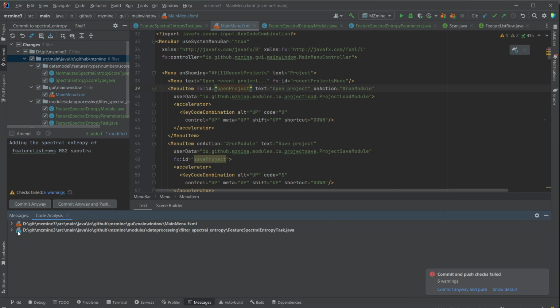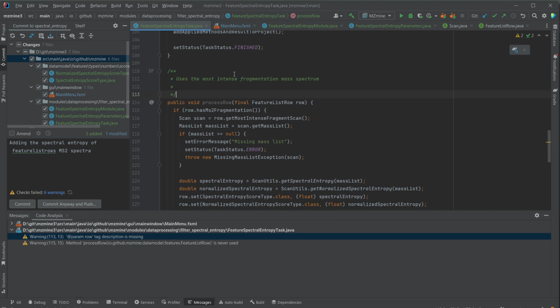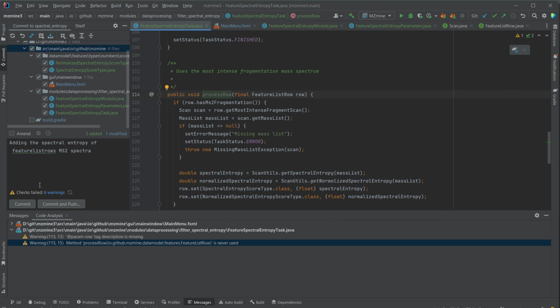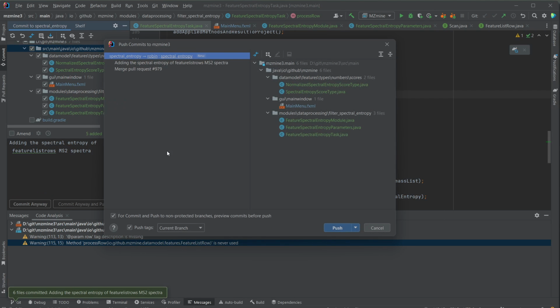It's going to tell me that there are some other things now. So still we have a parameter row that is not being described. Okay, so I delete it, and then it's still not used. But we know it's not used, so it's totally fine to keep it here just as a reference. And then we can go forward and we commit and push the changes.